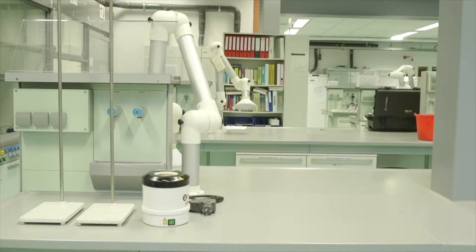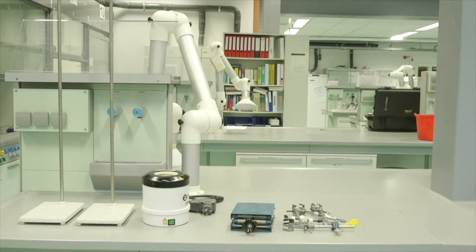Two stands, an isomantle, a support jack, clamps, plastic clamps, two lengths of tubing, and a distillation or round bottom flask.